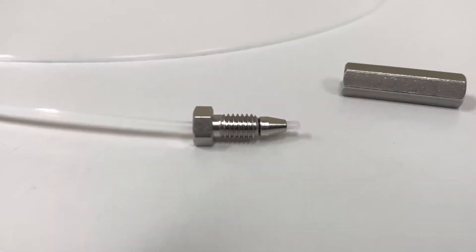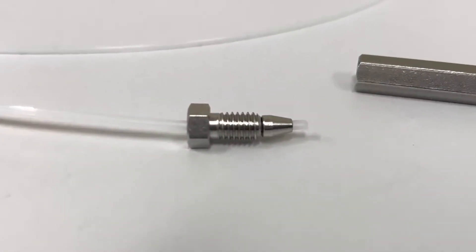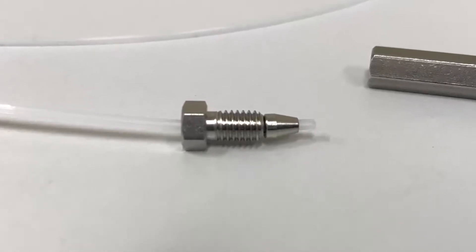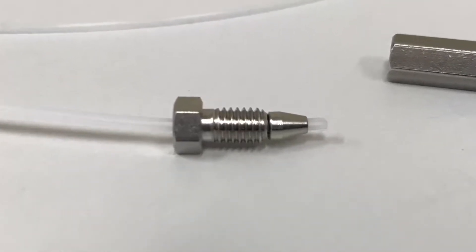It is important to know how to create these fittings, so you can install different column sets, configure instrument components, or optimize the amount of tubing in use.